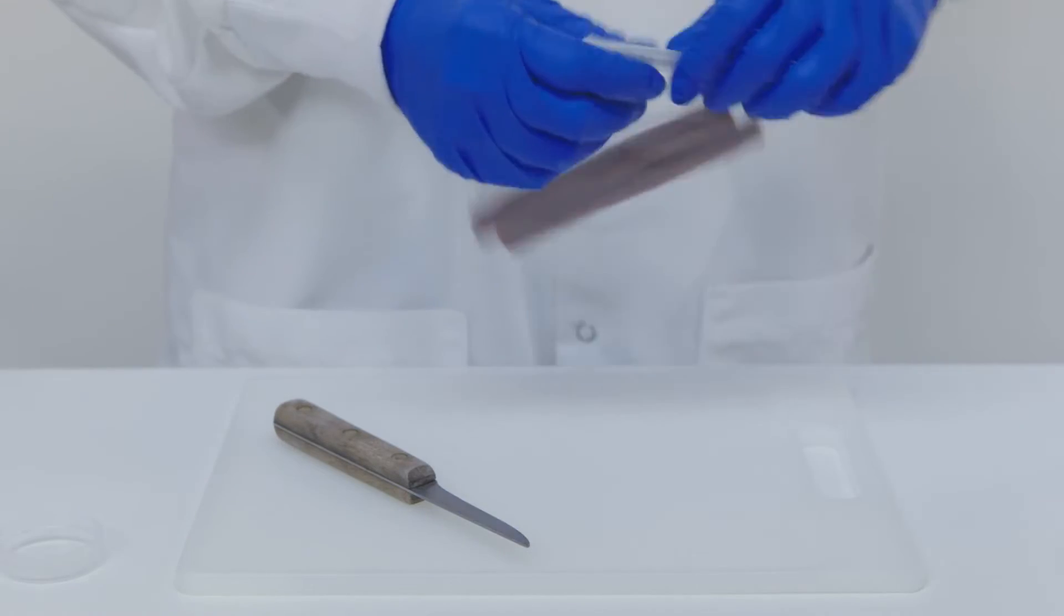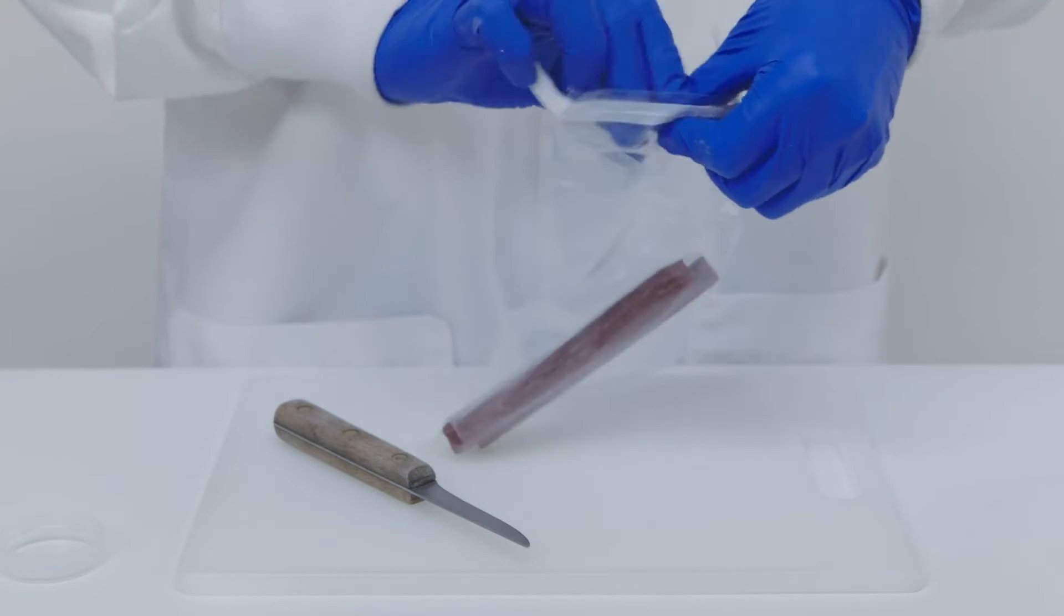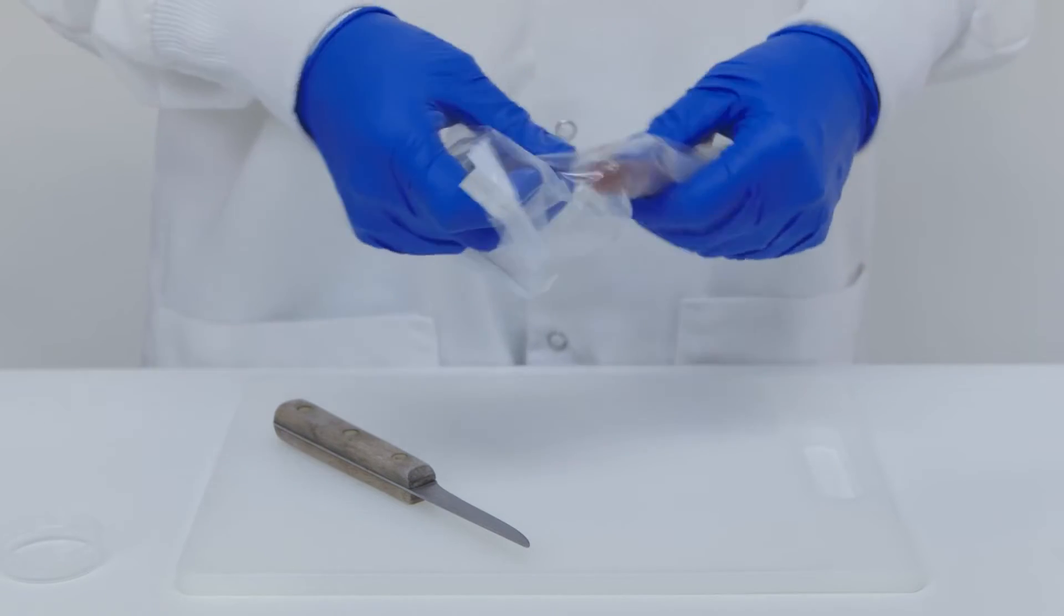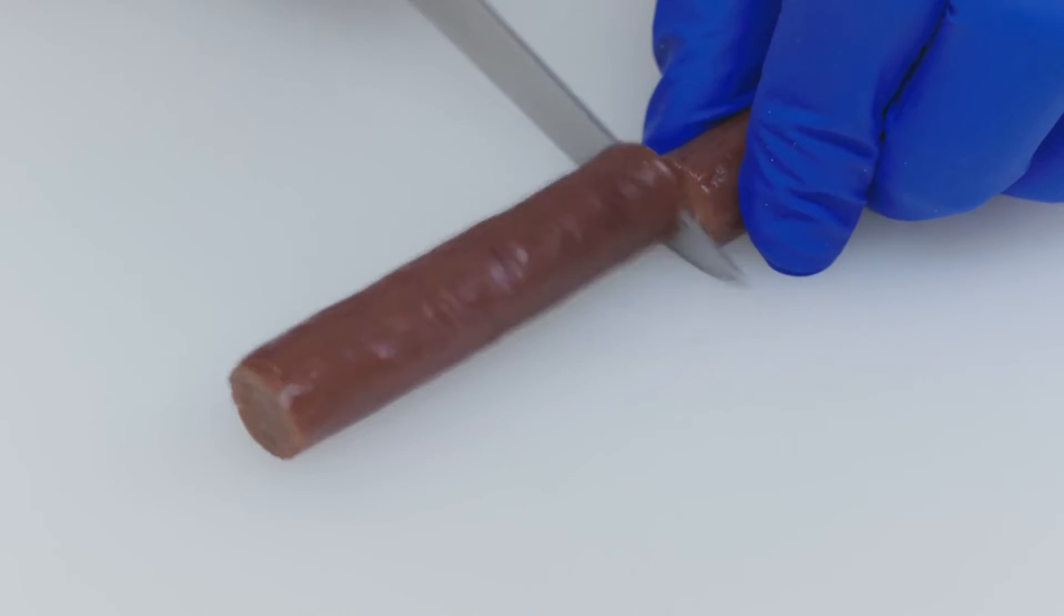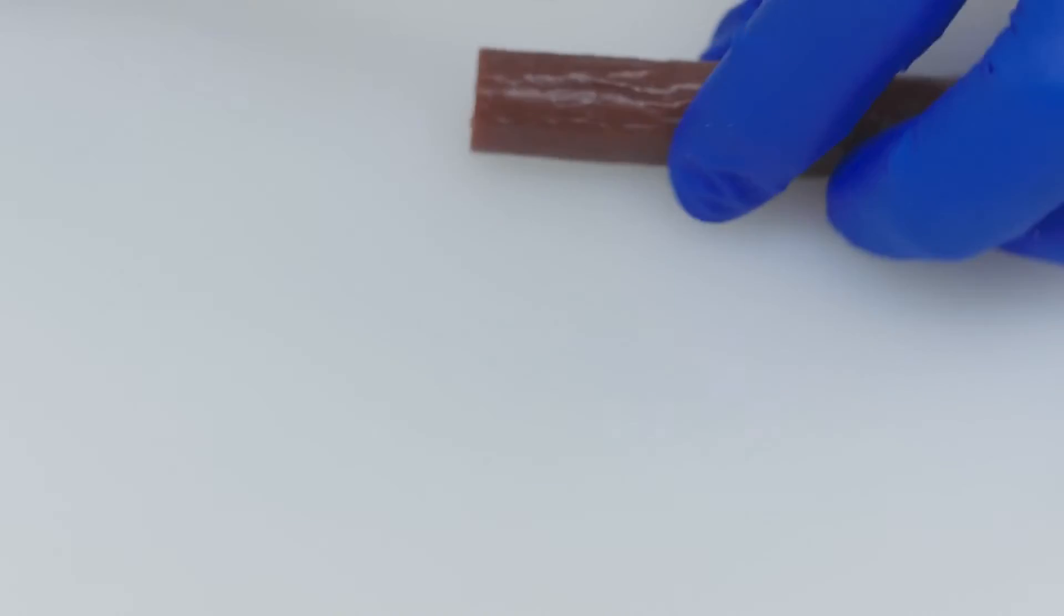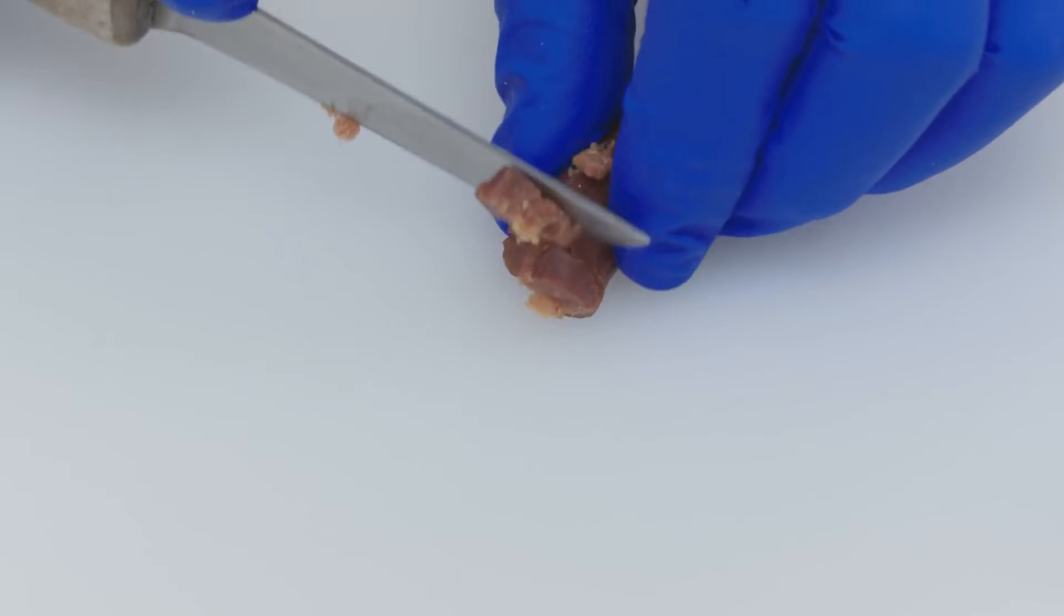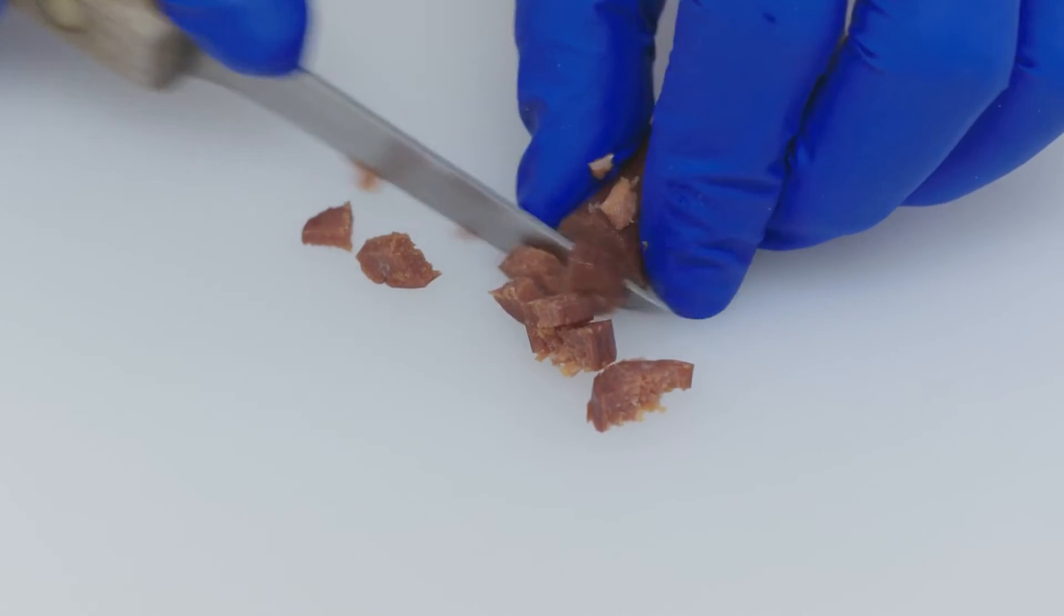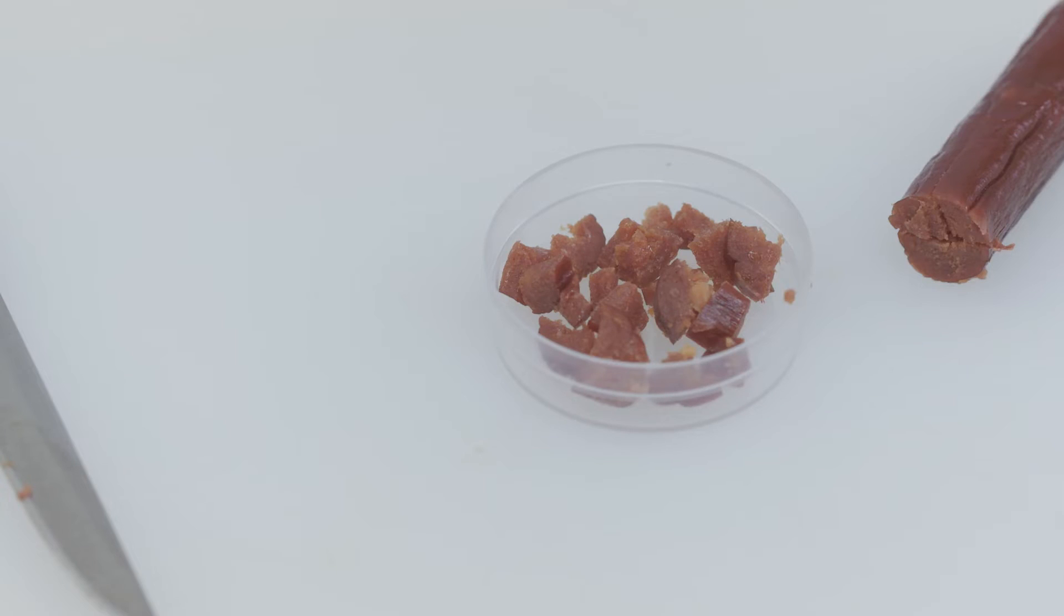In high-fat products, like fatty meat and desserts, the oil and fats become a moisture barrier. These products are slow to emit moisture. The sensors will work equally fast on these products, but the products themselves simply need a longer time to come to equilibration. A quick testing method will give you an inaccurate result. If you're testing these kinds of products, you may want to talk to someone on our support team about how to get the fastest, most accurate test results.